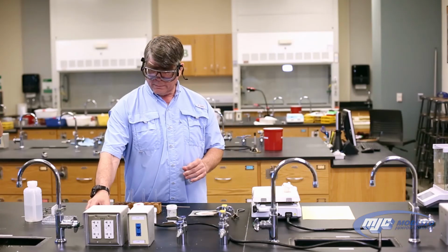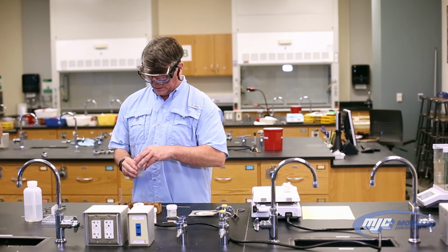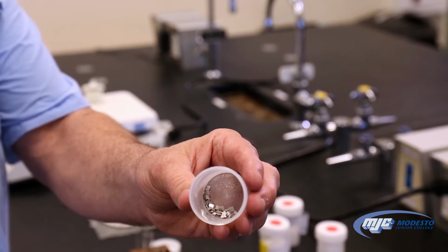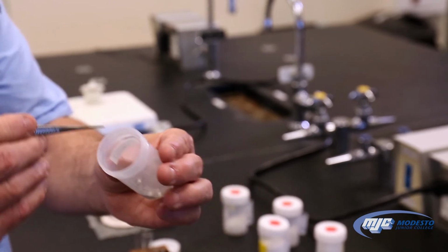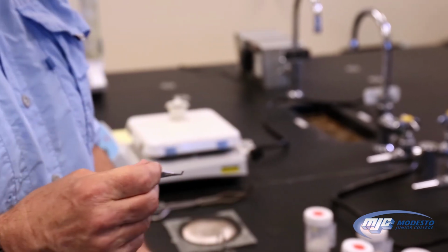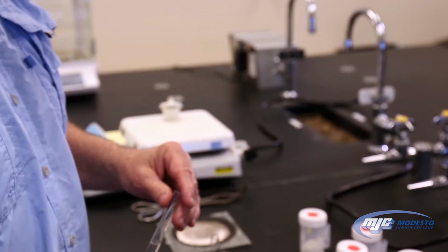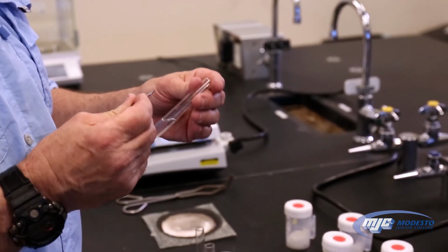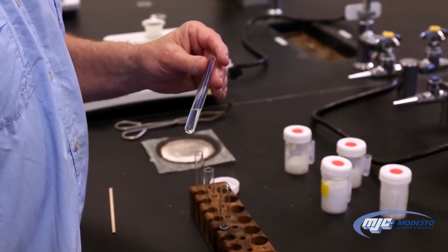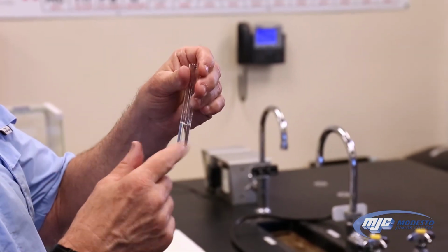And then we're going to take a piece of magnesium. And we don't need much, just one piece. They look like this. And the important thing to see is how shiny they are. So I'm going to take one piece. Uh-oh, which one is it? Drop it in. And usually it floats on the top, so we want to flick it to make sure it sinks.